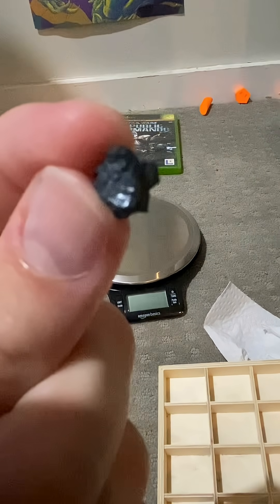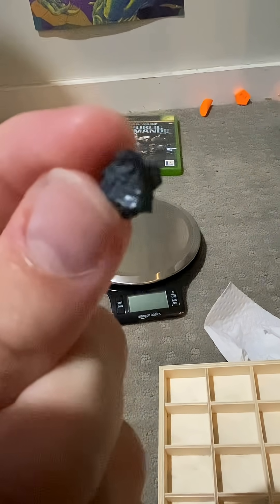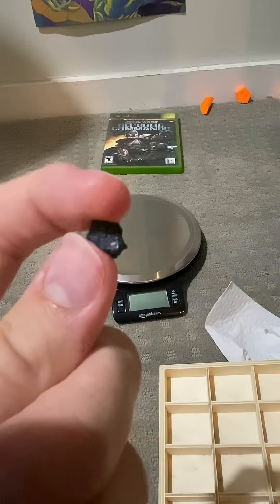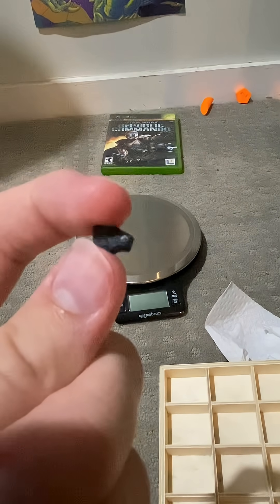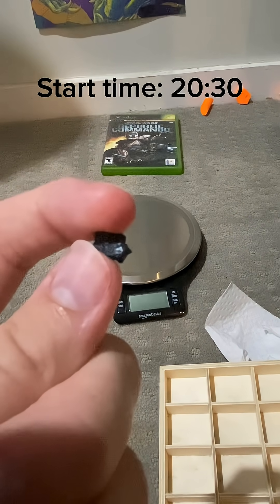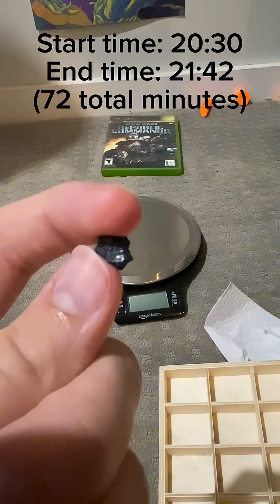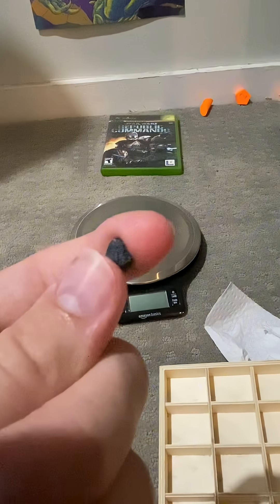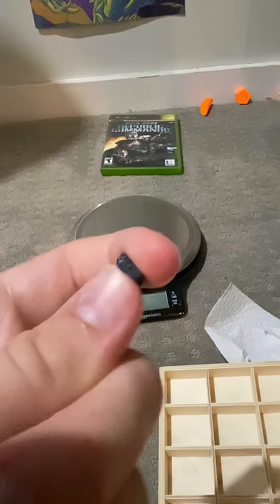Here it is one hour later. You can see it's still shiny. This is because the reaction takes a couple days. I started recording the time lapse at 8:30 and ended at 9:42 in the afternoon — so that was specifically 72 minutes.